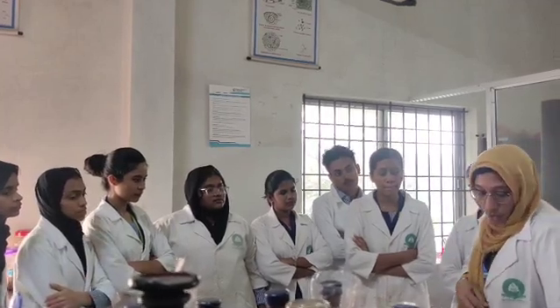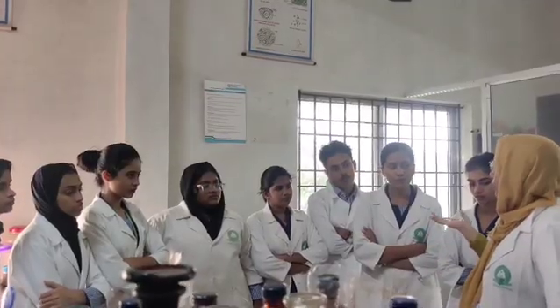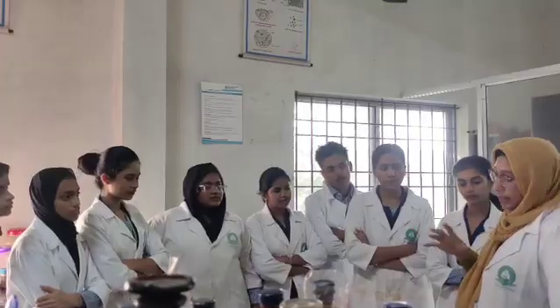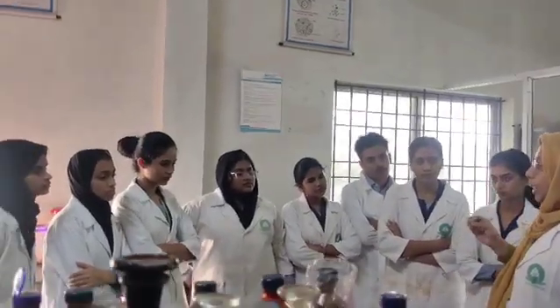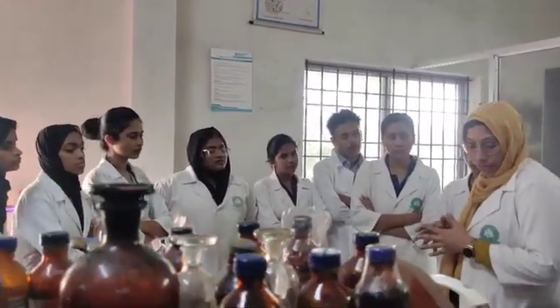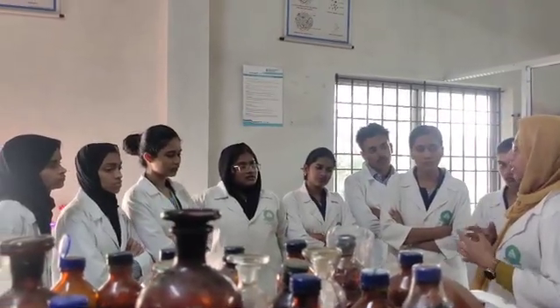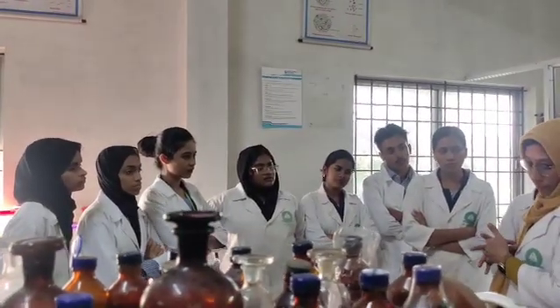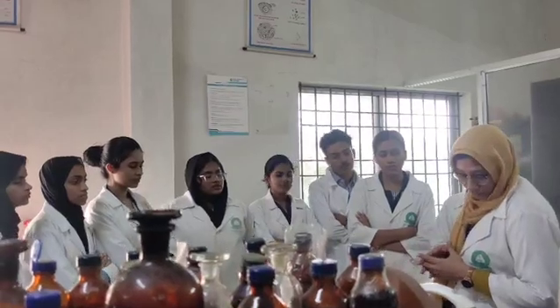Then we have to do the reducing sugar test. As we mentioned in acacia, what test do we do for reducing sugar? Fehling's test. So here we do the same: a mixture of equal volume of dilute hydrochloric acid and a solution of agar is heated in water, and then we add both Fehling's solutions. The observation will be a red precipitate. That red precipitate indicates the presence of reducing sugar.